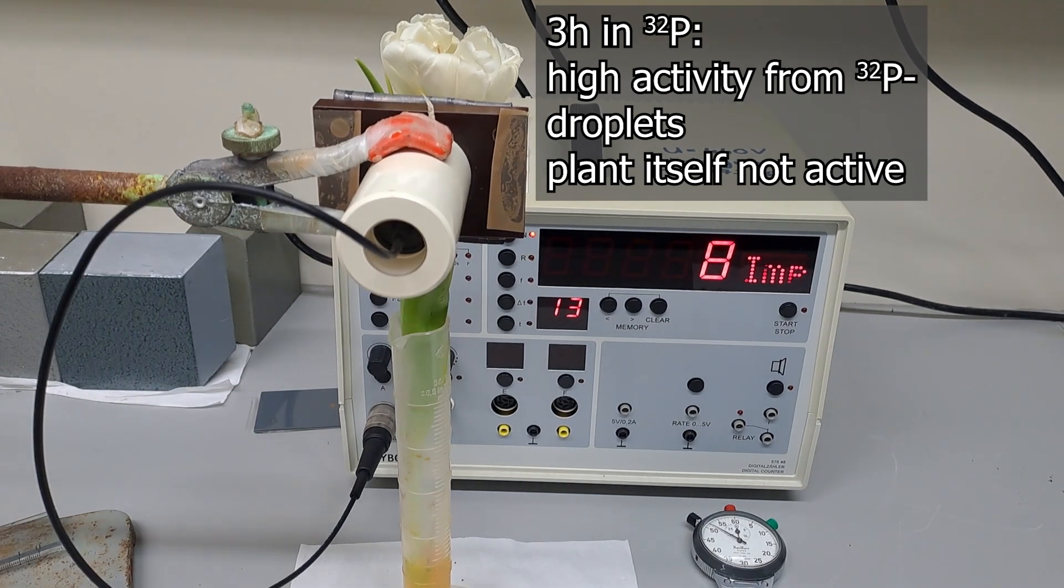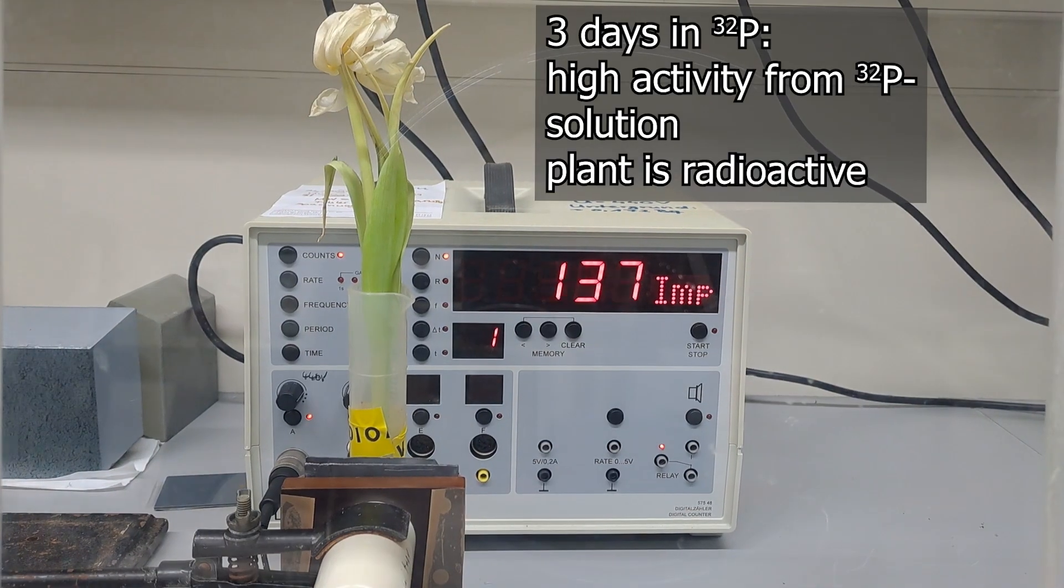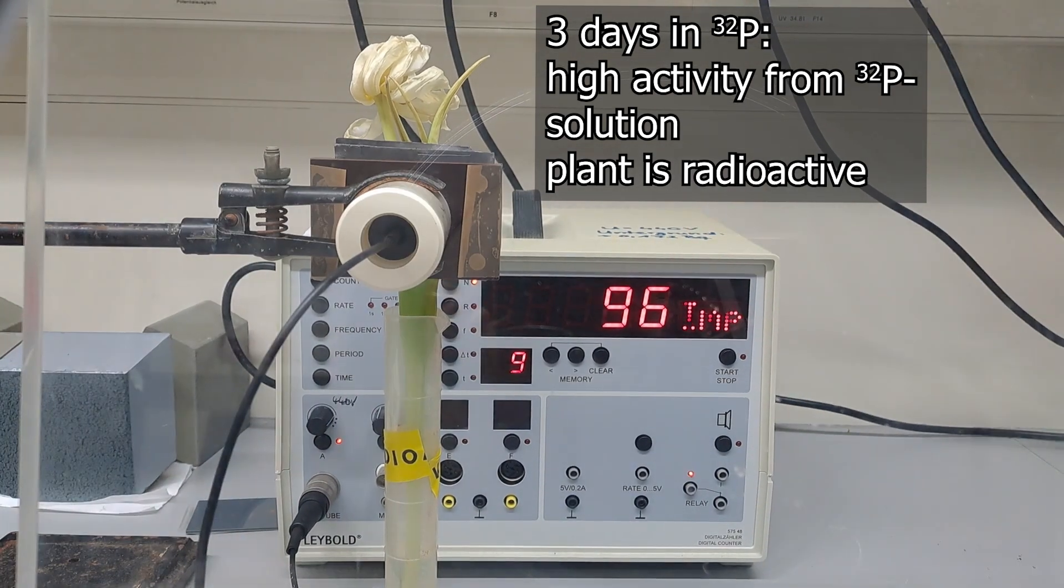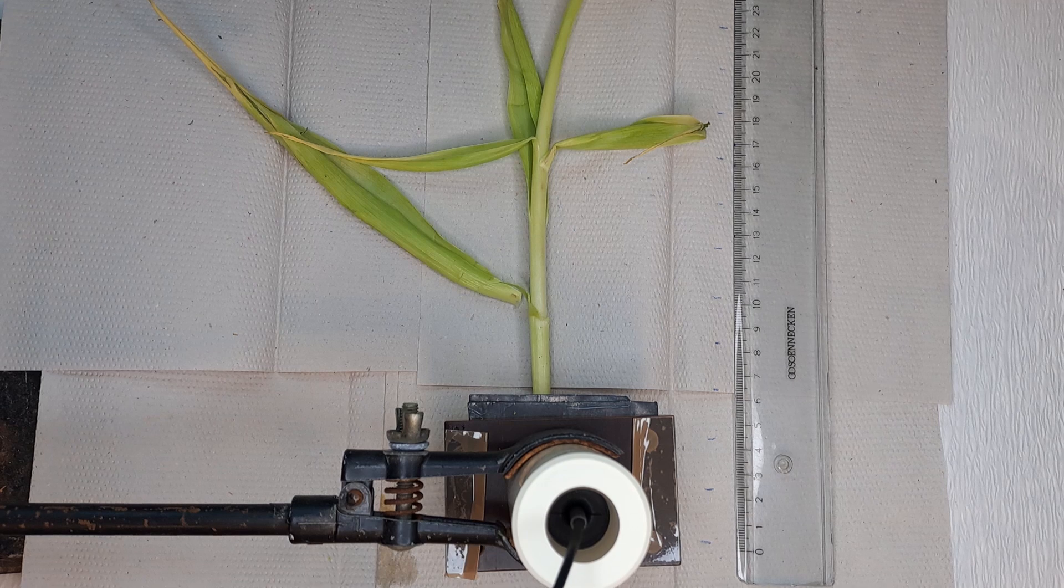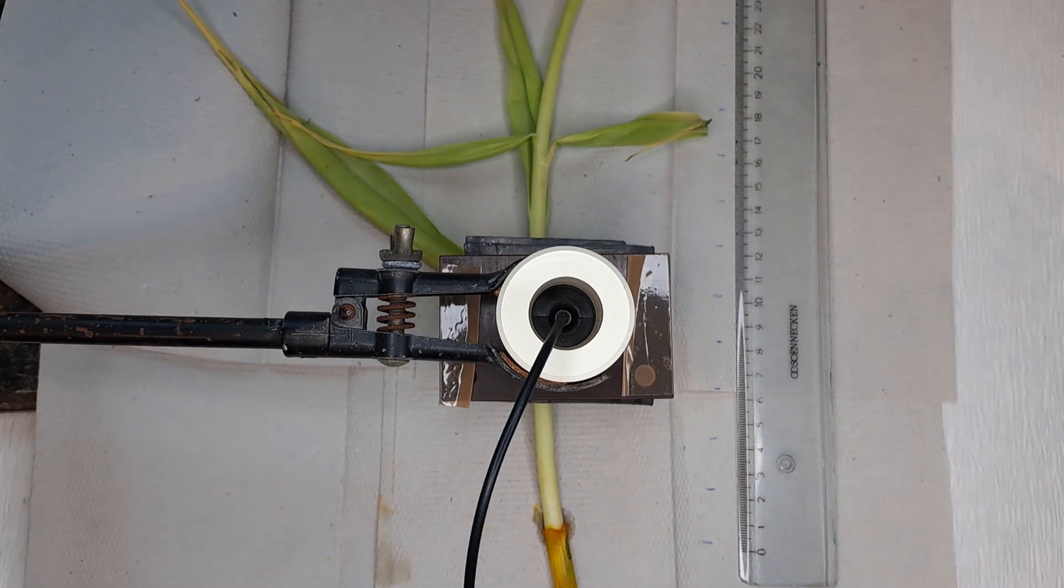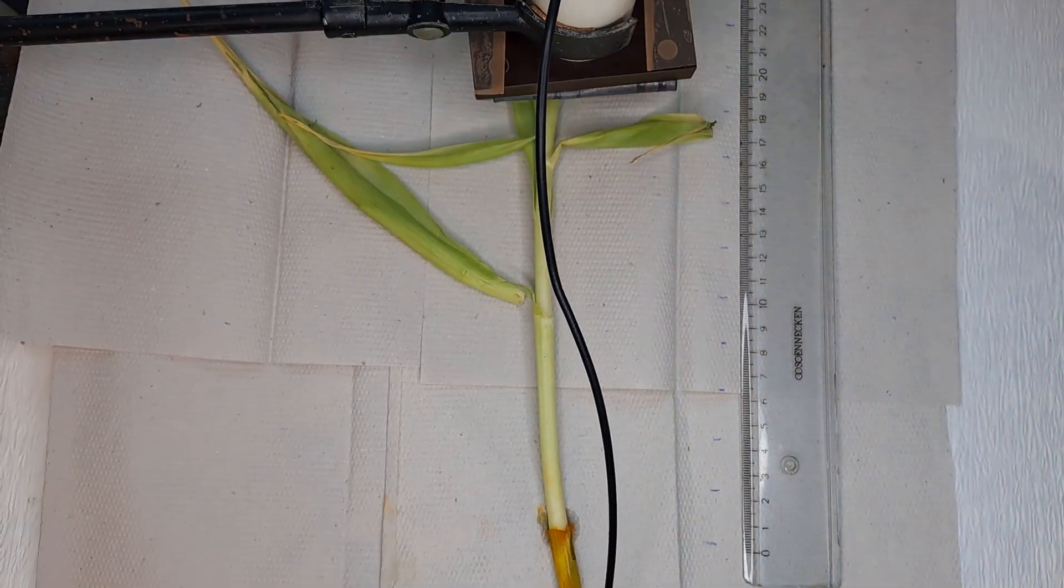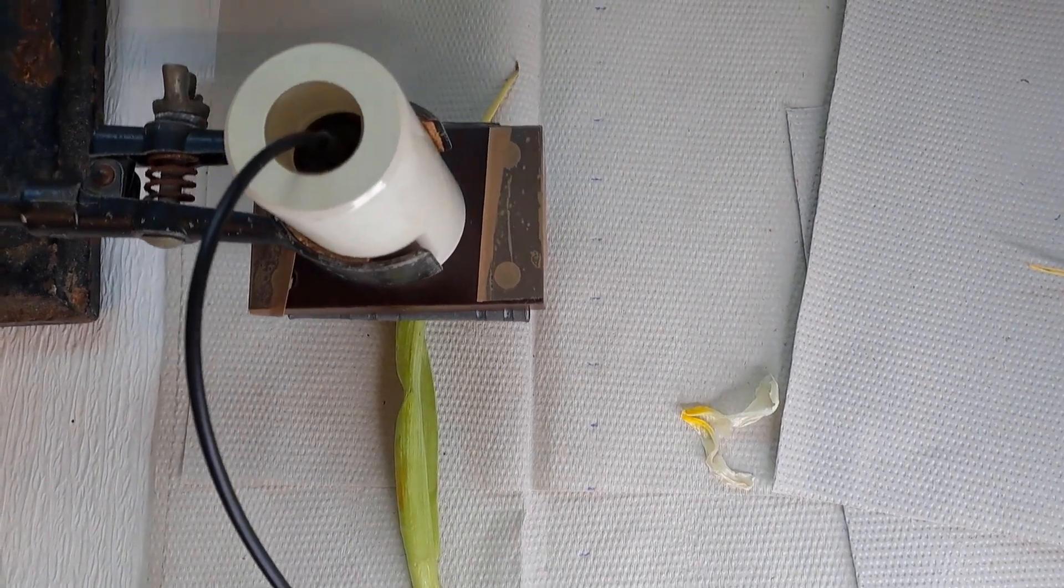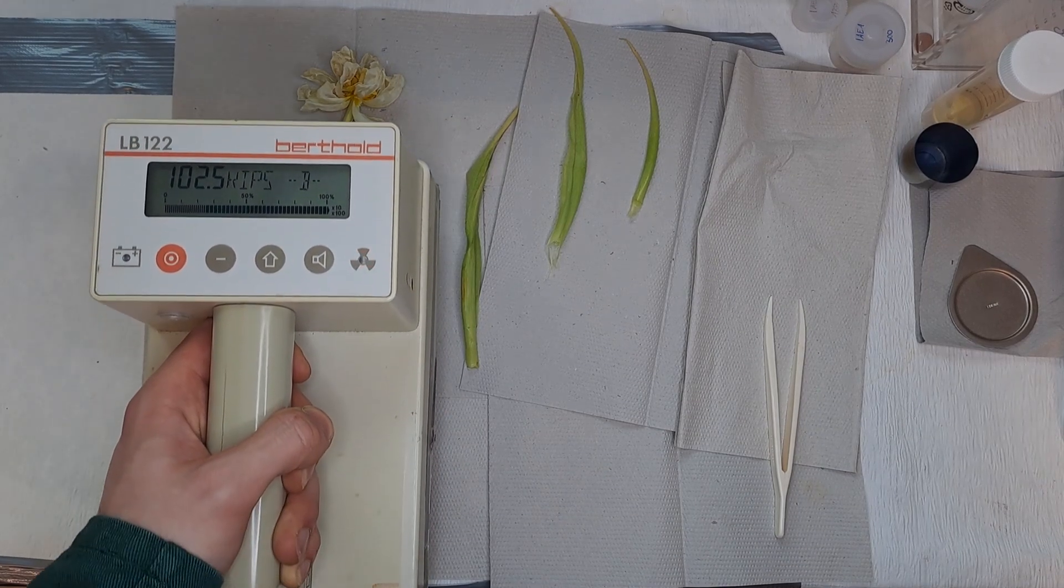After three hours, not much activity was in the plant. However, after three days of waiting, the flower became very active. The counts were much higher, and to have a better count rate, I rotated the container 180 degrees and measured yet again. The flower was then dissected. I first measured without the plastic cylinder and the lowest position registered at 22,307 counts. Each measurement was taken over 30 seconds, followed by a 30 second break, while I moved the detector two centimeters away. Now take a look what the contamination monitor reads: 114,000 counts per second. That's something I've never seen before.